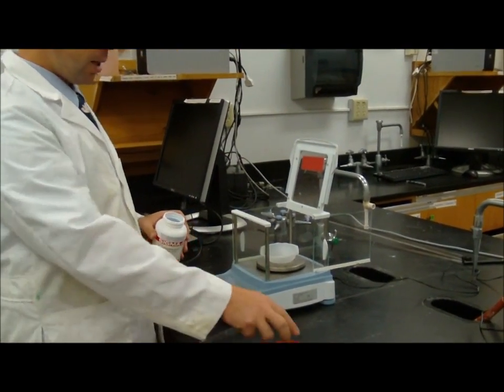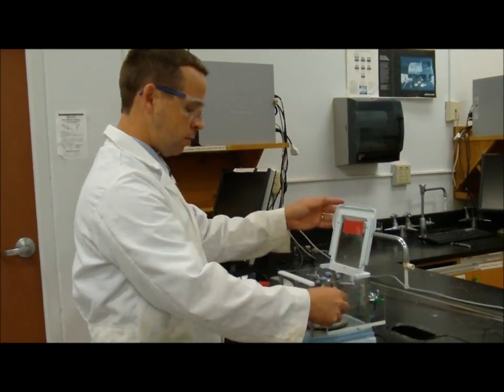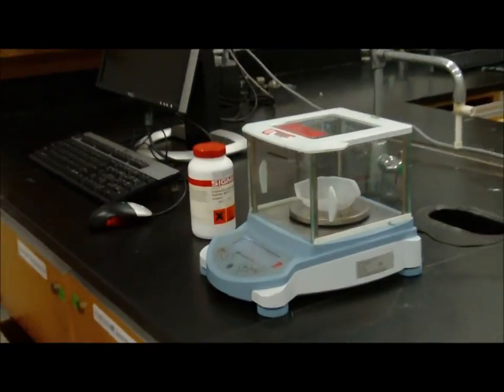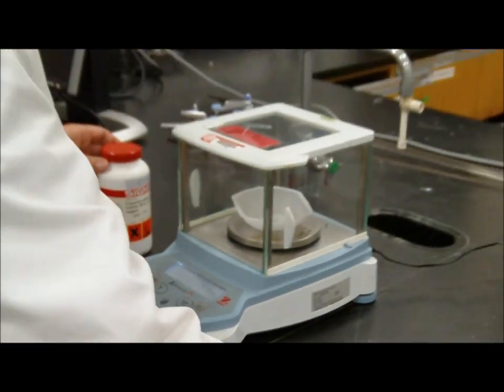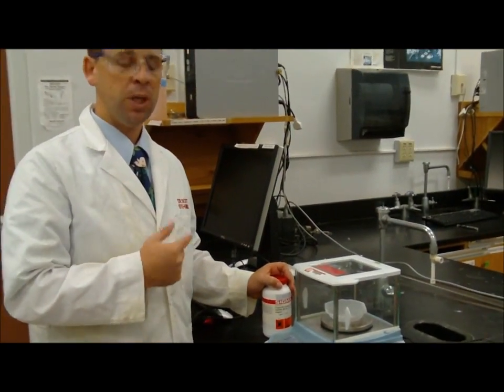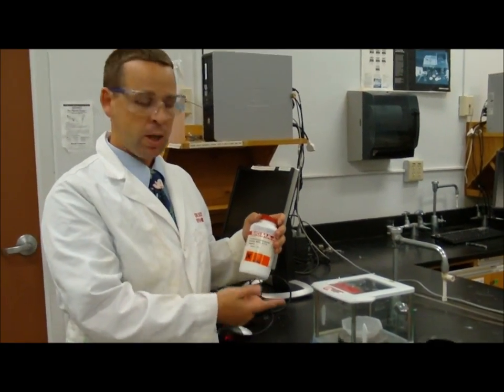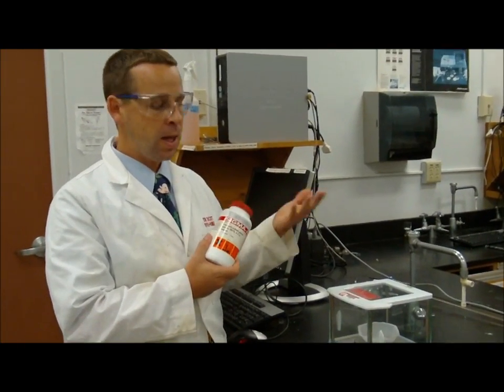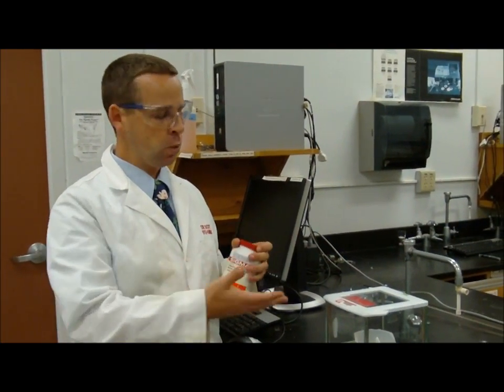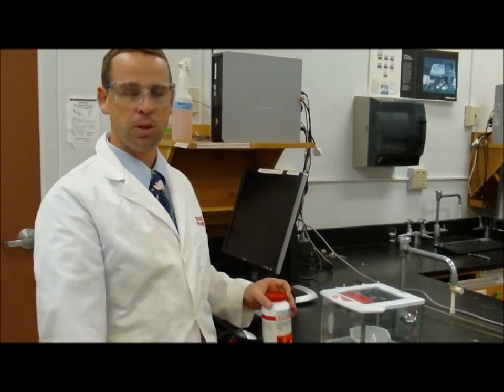All right? I said I wanted to weigh out 0.1 grams of copper sulfate, and you see here that I have 0.186 grams. So I've gone over, which is very typical. With practice, you will try not to go over, because once you go over, that copper sulfate that you're over by should not go back into this bottle. If it goes back into here, then everybody who works with the copper sulfate increases the chances of contaminating this bottle every time they put their sample back.